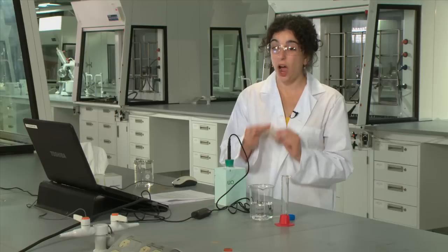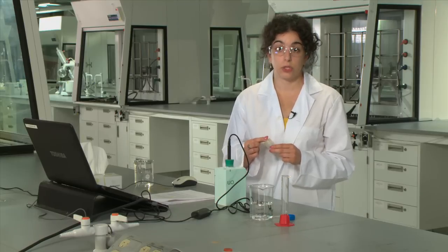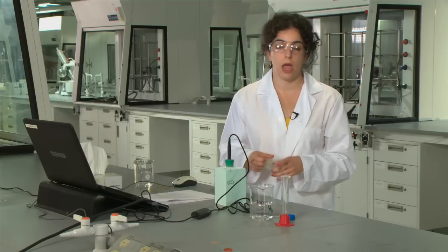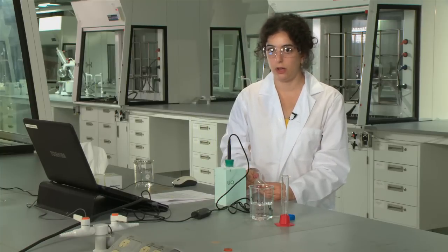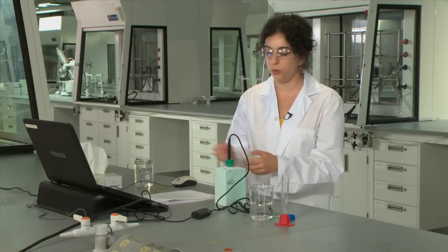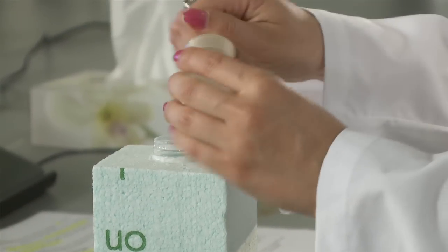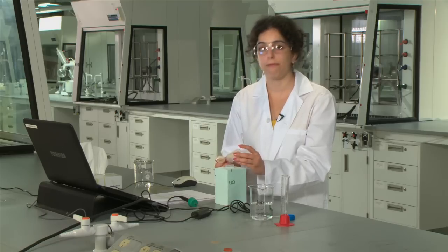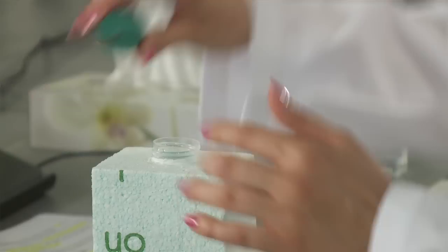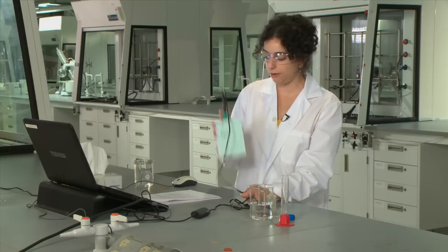When you are weighing the anhydrous sodium acetate in particular make sure that you transfer it fairly quickly because the anhydrous salt is hygroscopic and will start absorbing moisture from the atmosphere. Also if others are transferring out the anhydrous salt in between you want to make sure that the lid of the reagent container itself is at least covering the top of the container. So then you'll take that salt once you've weighed it and you will transfer it all into your calorimeter. Transfer it as quickly and as fully as you possibly can making sure that you don't have a significant amount of salt left over in your weighing bottle because this will affect the concentration of this solution and might affect your temperature results.